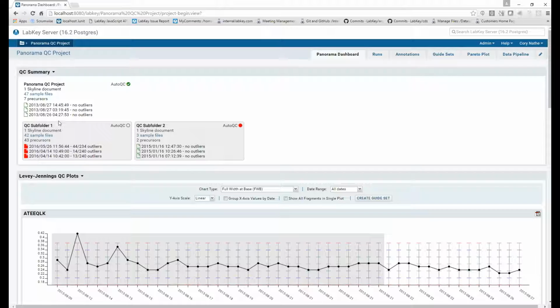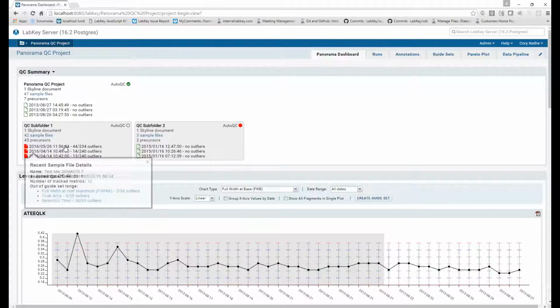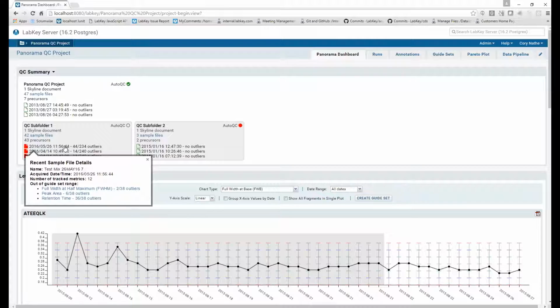The current container that I have does not have any outliers for the guide set that I created. However, the subfolder, as you can see, shows outliers to various degrees for the 3 most recent samples. And you can see that one of them, in fact, has far more outliers than the other, and at a glance, the user could then hover over that sample file to see more information, and in this particular case, see that the retention time metric is the one with the majority of the outliers. So they could click on that link from this pop-up to go to that container and look at that metric and see exactly what's happening for that sample file.